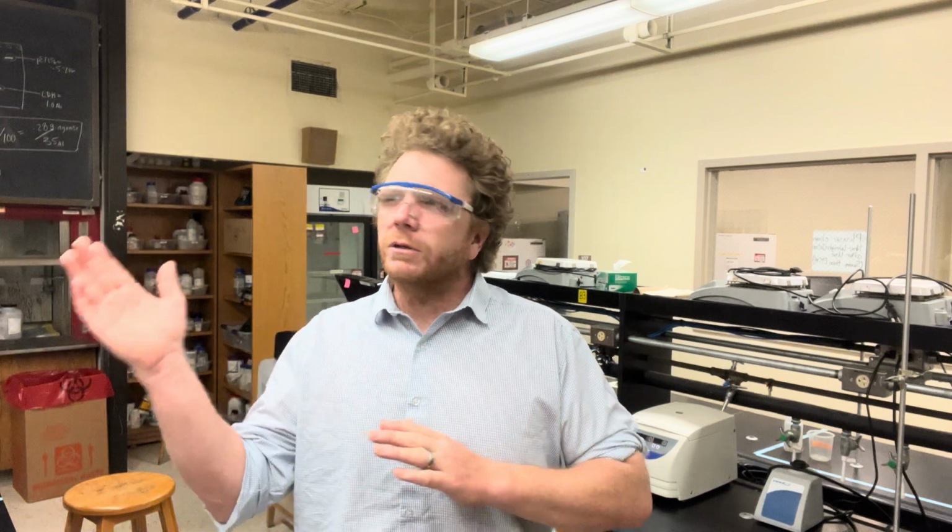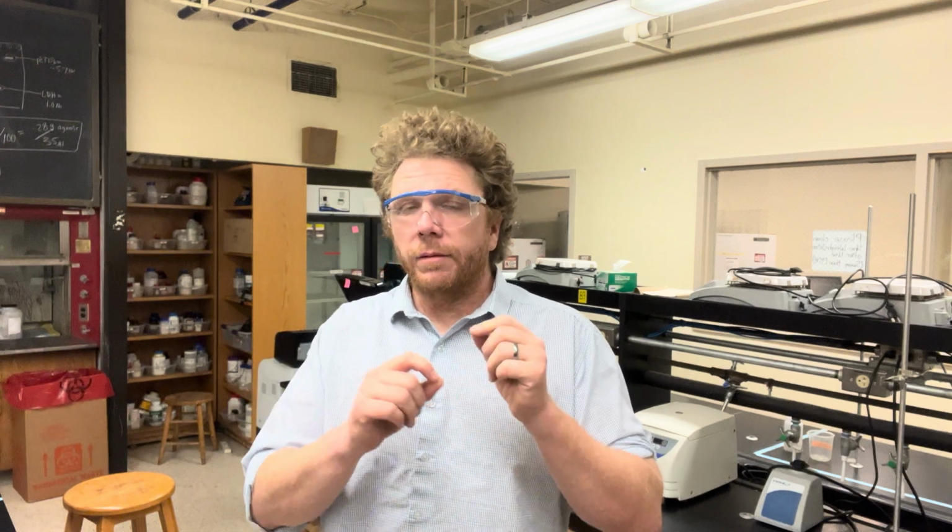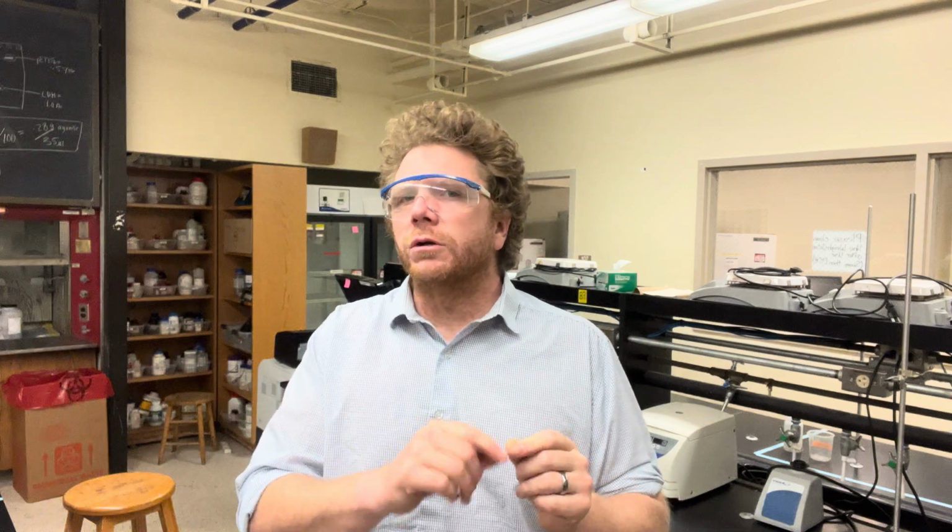The most important part of any Bradford assay is understanding your linear range of your line of best fit. If something falls outside of the linear range, well, then you can't really predict what the concentration is based on the absorbance of that sample. So what you're going to do is you're going to do a series of dilutions, and maybe you'll do 2, maybe you'll do 1, but you'll do a number of different dilutions and determine based on the absorbance of that dilution what approximately is the undiluted unknown protein sample's concentration.